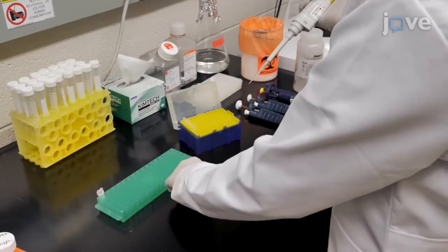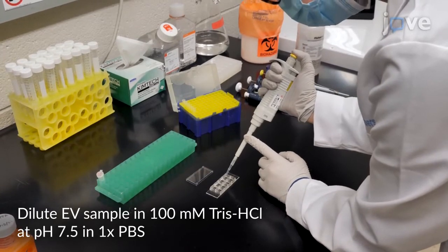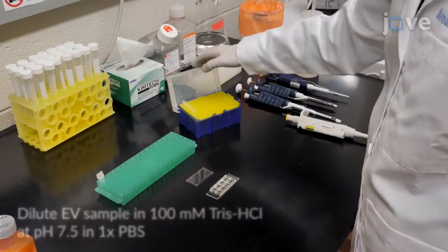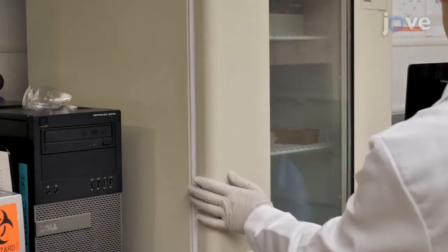Begin by placing affinity-purified extracellular vesicles, or EVs, onto glass-bottom microslide 8-well plates in a total volume of 200 microliters and allow them to adhere to the surface overnight at 4 degrees Celsius.